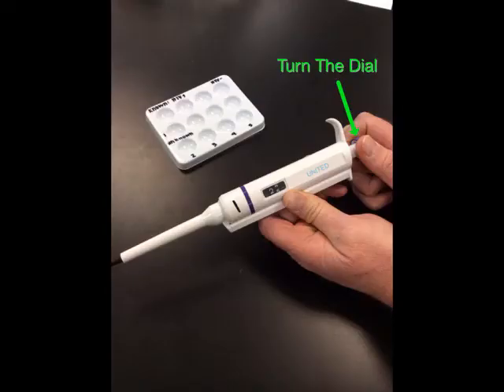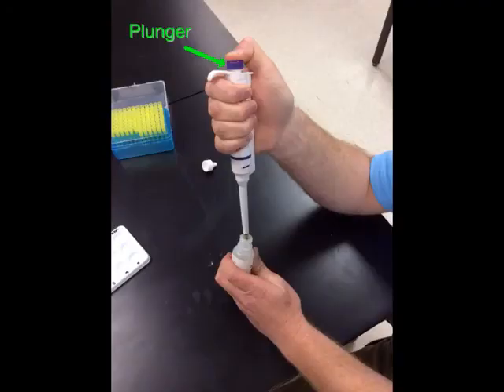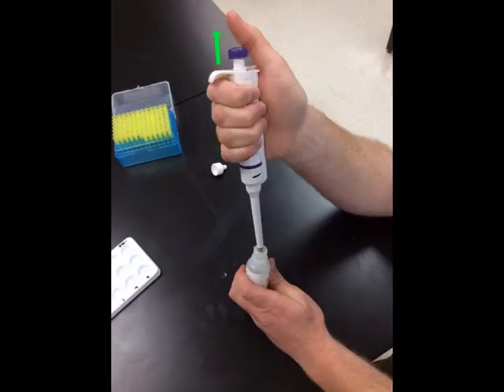Set the micropipette to 25 microliters. Obtain a micropipette tip from the tray. Push the plunger on the micropipette to the first resistance point. Then stick the micropipette into the first solution. Release the plunger to suck up the solution in the micropipette tip.